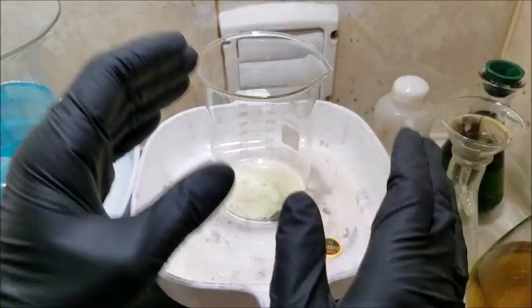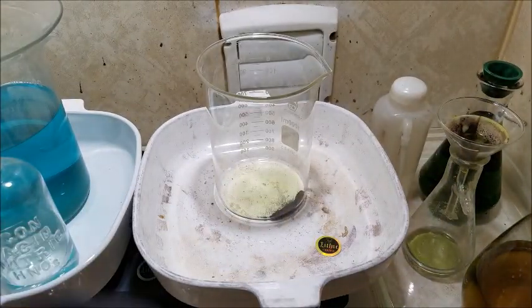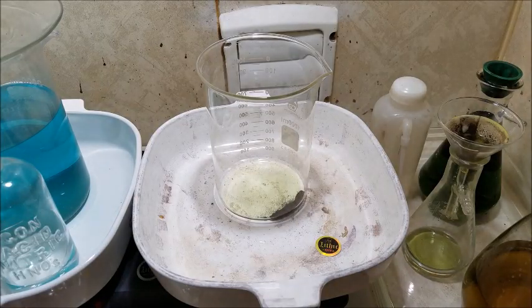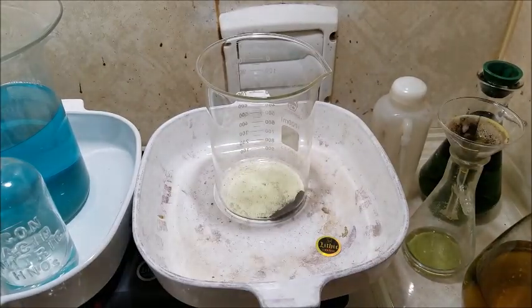I just can't believe that there was this much gold in there, and yet when we did a stannous chloride test, we barely got results. So I'm not going to hold my breath. I think I'd like to dissolve this batch one more time in aqua regia and see what we get out of it.